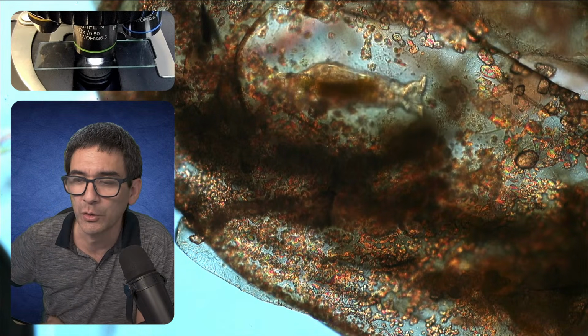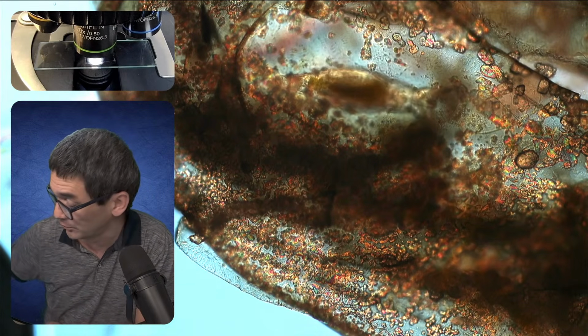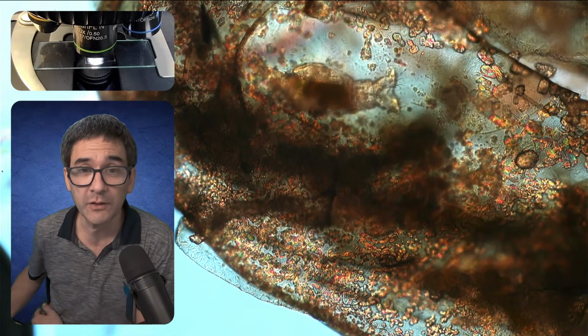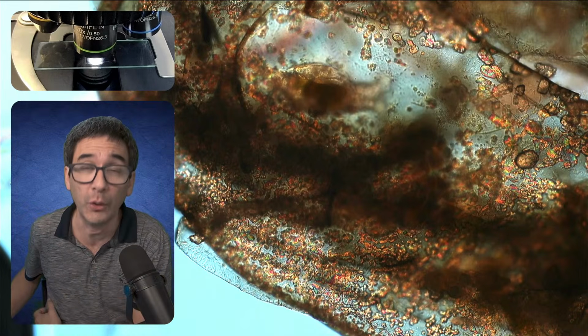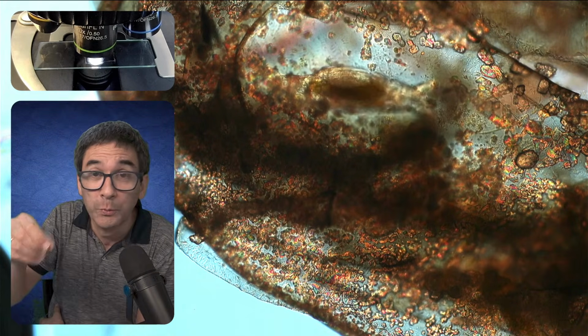It looks like the moss is completely soaked in water in the test tube. I'm not sure if it's recommended to do that. Well, no, it's not recommended. But as a matter of fact, this piece of moss was actually floating completely in the water in the fountain. So I kind of scooped it up.